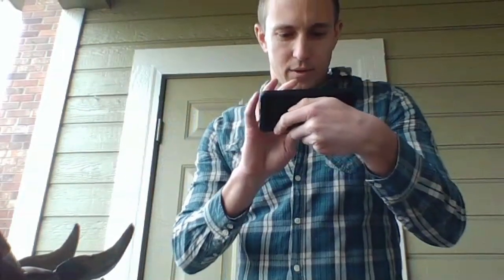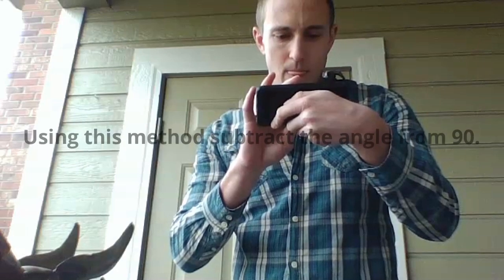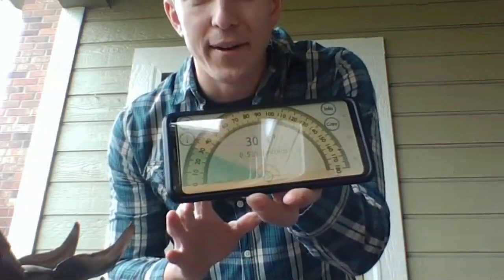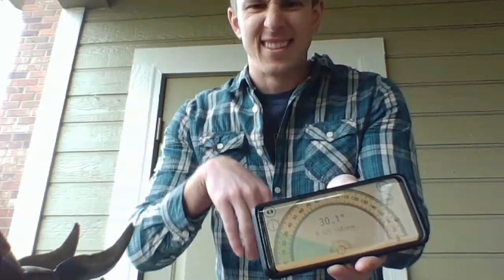Okay, I'm going to hold it a little bit closer to me so I can see that a little bit better. Yeah, okay, 30.1. That feels good. Does that feel good to you guys? Feels good to me. Let's just work with it.